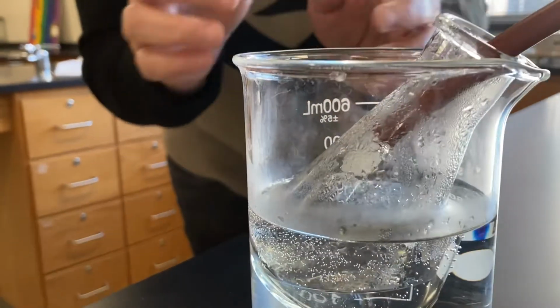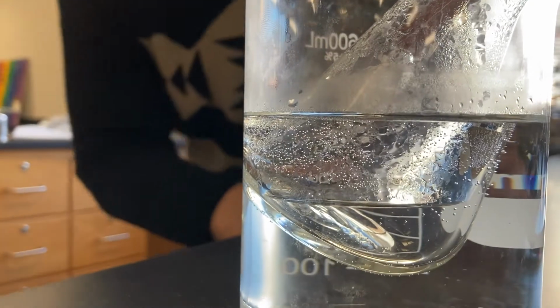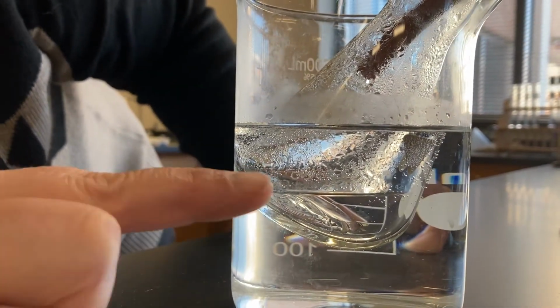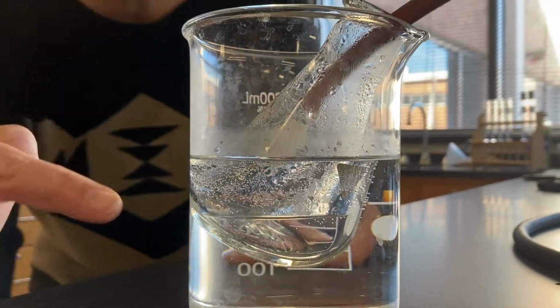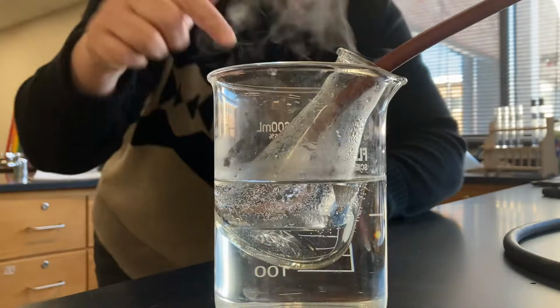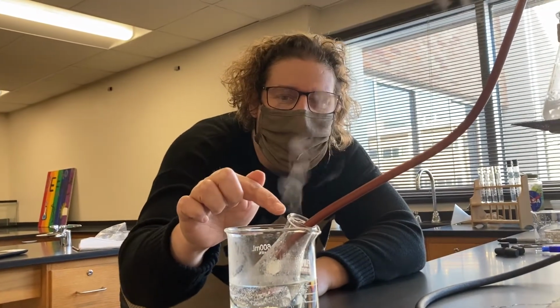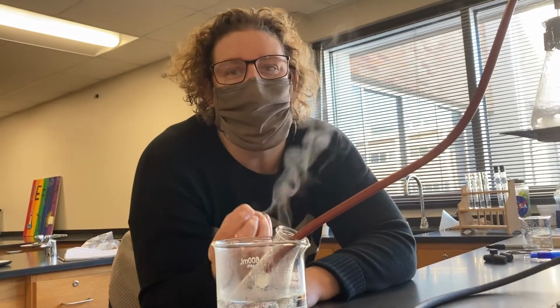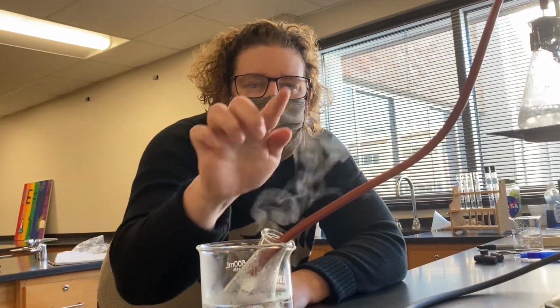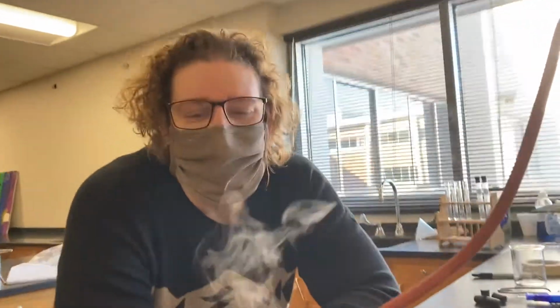orange tubing into this small flask. And so as Mrs. Von Eschen zooms in, you can kind of see where that line in that triangular shaped flask, that's the liquid water that we're collecting at the end of the process. And you might also notice this steam coming out from this flask. So we're not quite able to capture all the water. Some of it is escaping still as that steam, that vapor, but that's okay for this lab.